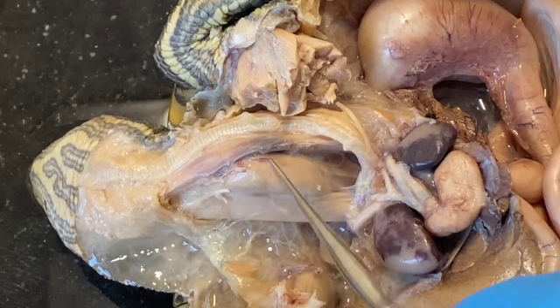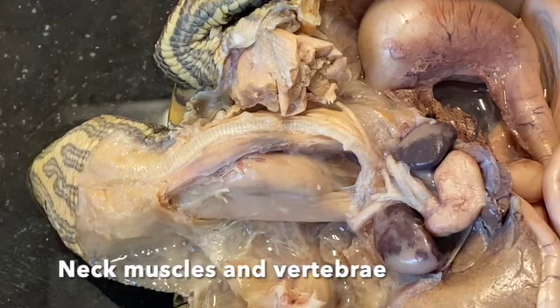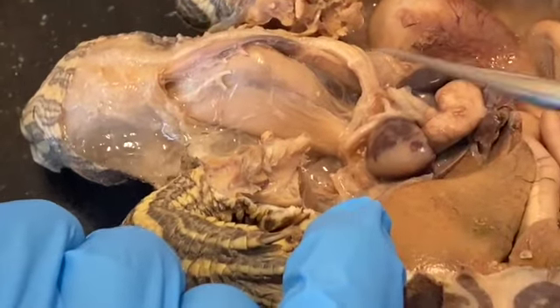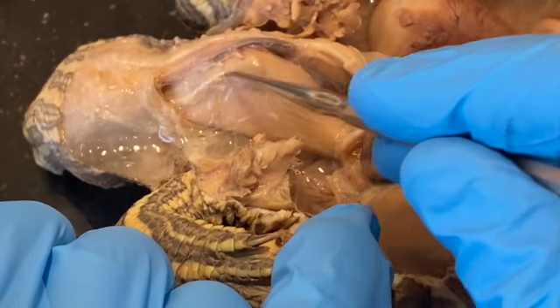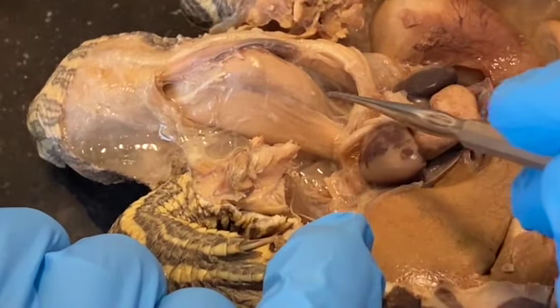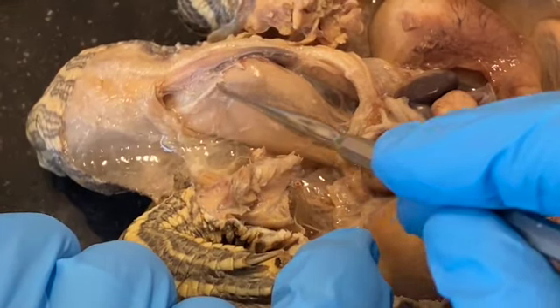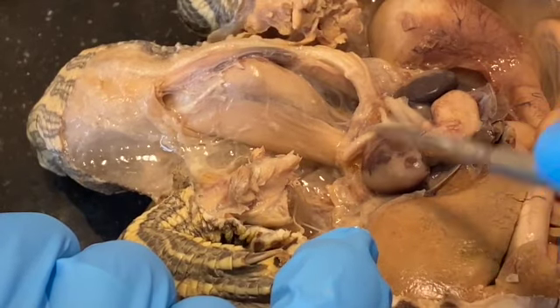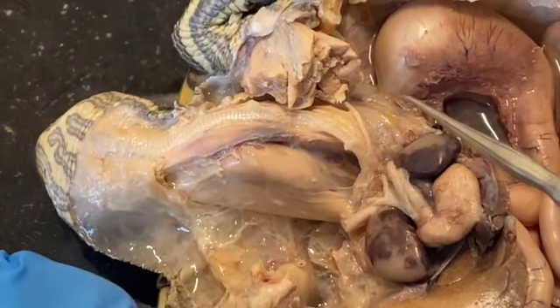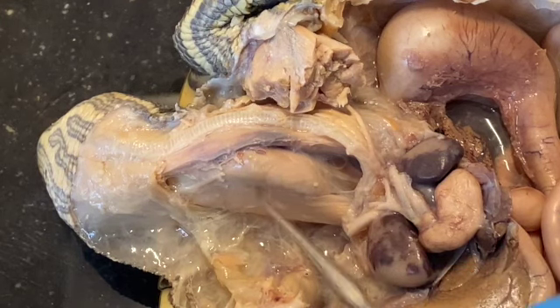And this structure right here is the muscle and vertebrae of the neck. I'm going to turn the specimen a little bit so you can see it. Look how it is arched. So it's arched up like this, or ventrally, and then in this direction. This turtle's head is partially withdrawn. The way that this animal does that is that this will arch even more so ventrally and then dorsally to allow the head to be drawn back inside of the shell. So again, we've got the trachea, esophagus, and muscles and vertebrae of the neck.